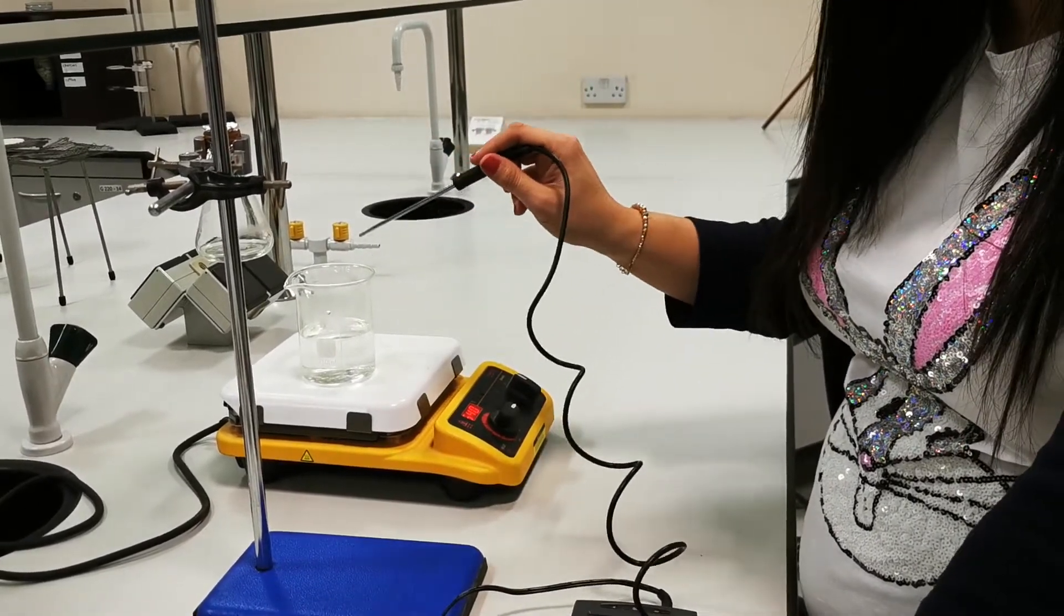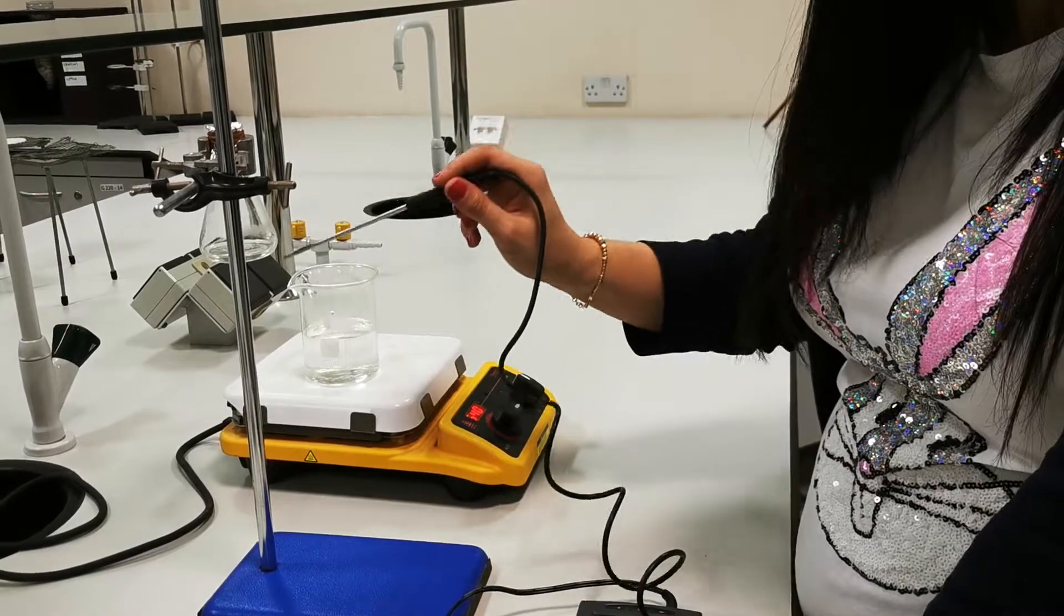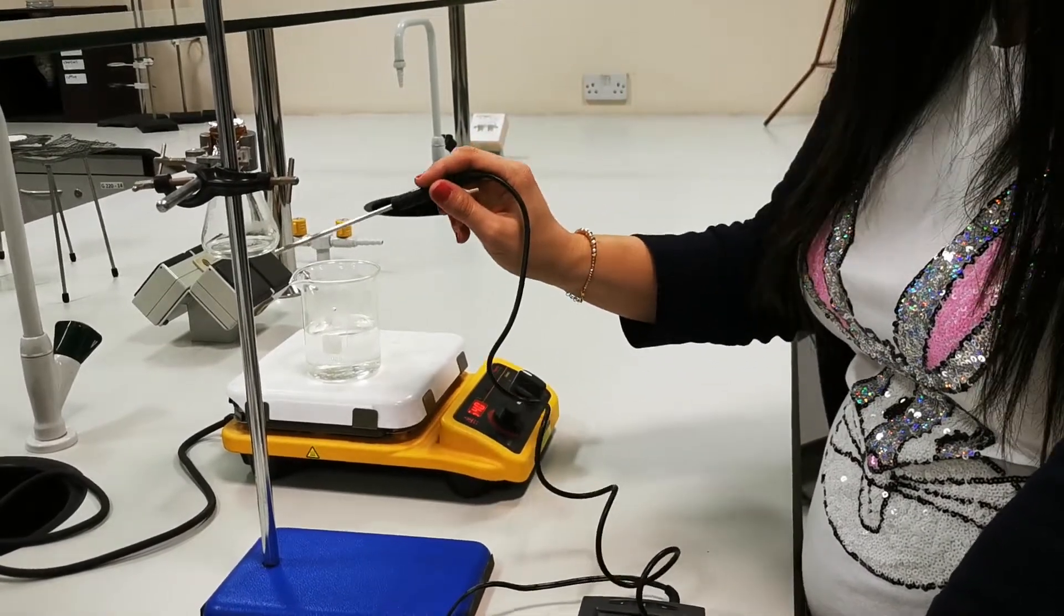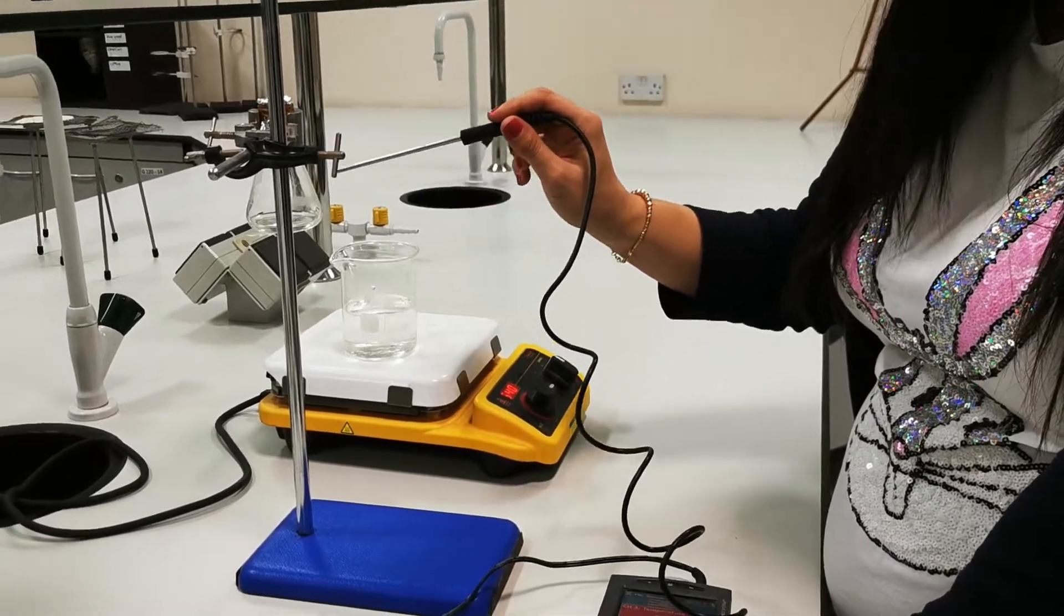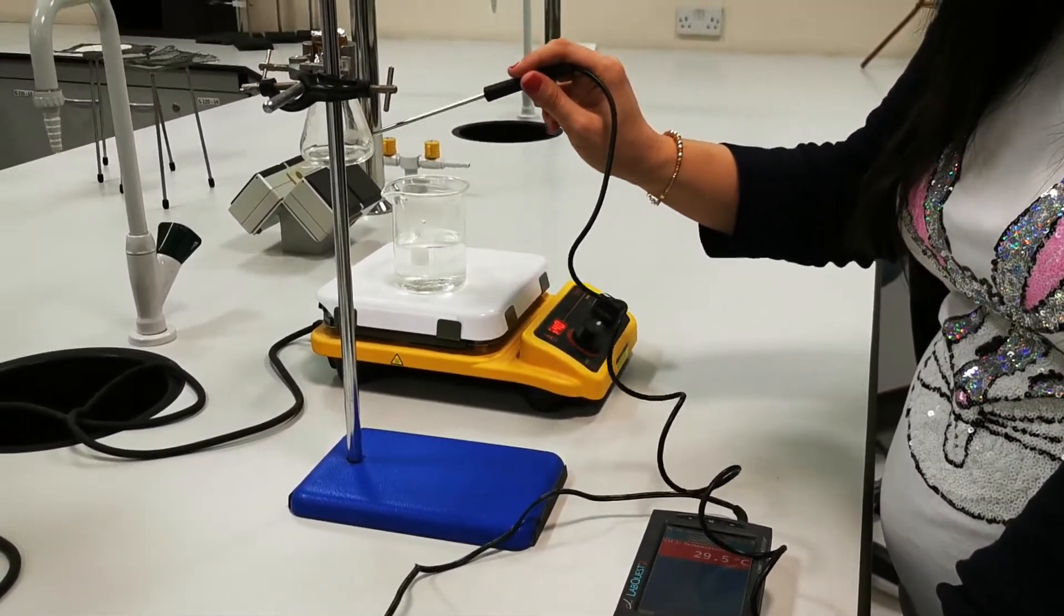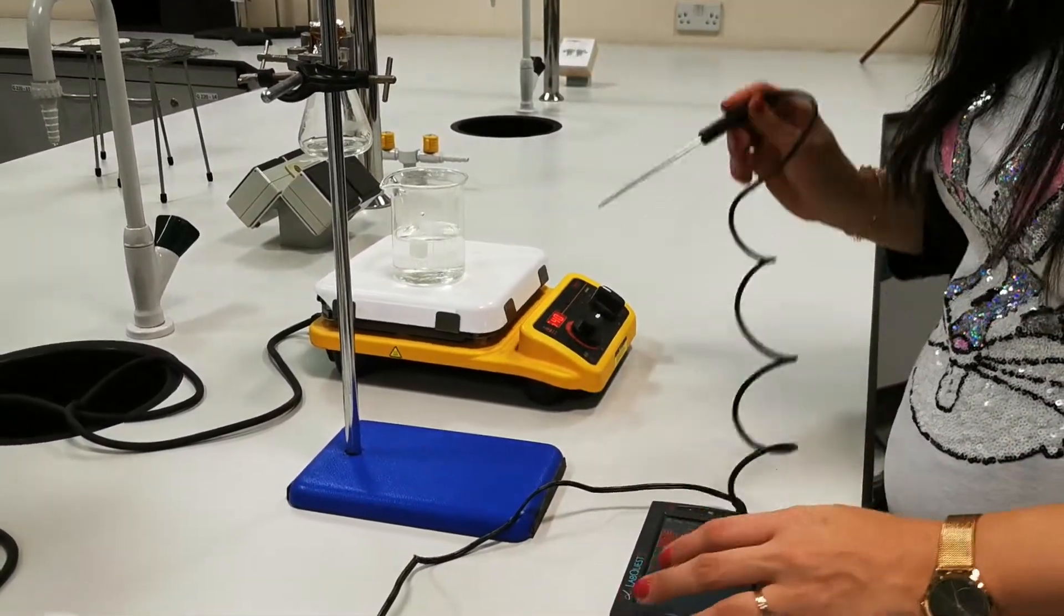And I will keep it inside the water until no more liquid in the flask, until everything in the Erlenmeyer flask, all the liquid changes to gas.